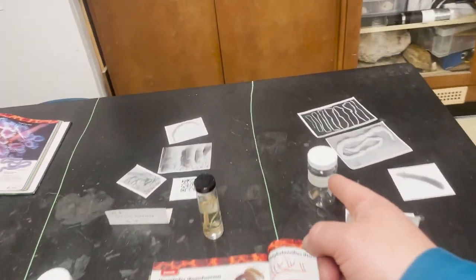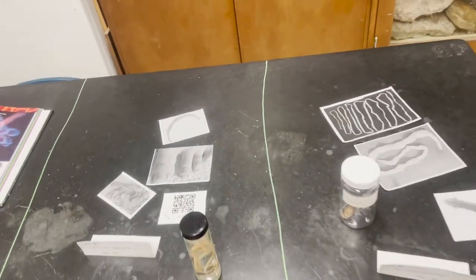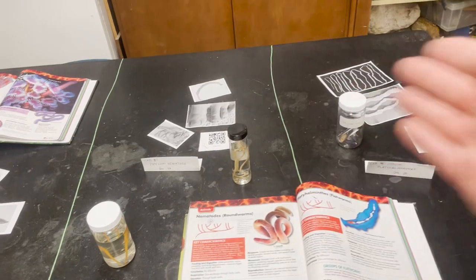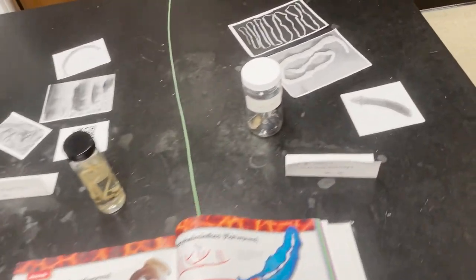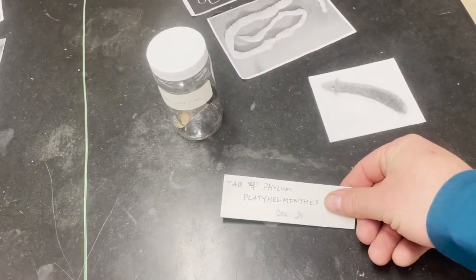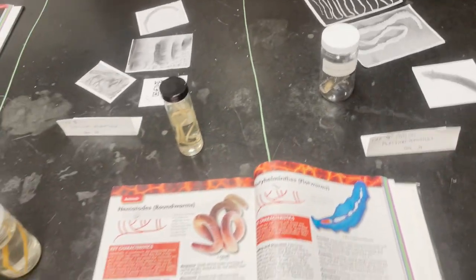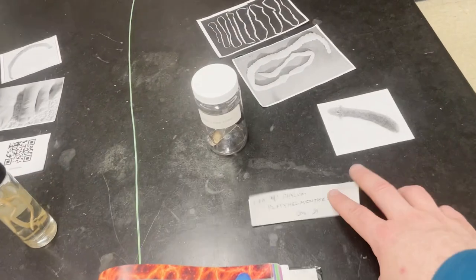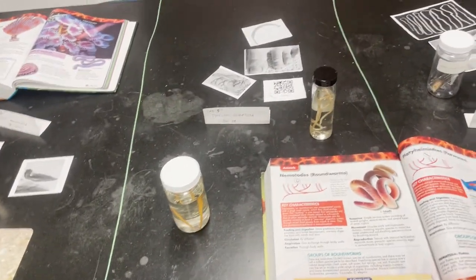Make sure when you pick up a specimen you put it back on the proper side of the dividing lines. We wouldn't want anyone to get confused about what members belong to which phyla. To help us out, there are little notes on the table and it also refers to a page in the textbook from the appendix called the Diversity of Life. So you'll notice Phylum Platyhelminthes is on the Diversity of Life page 39 — here we are, page 39. So if the book pages get flipped you can easily find some information.